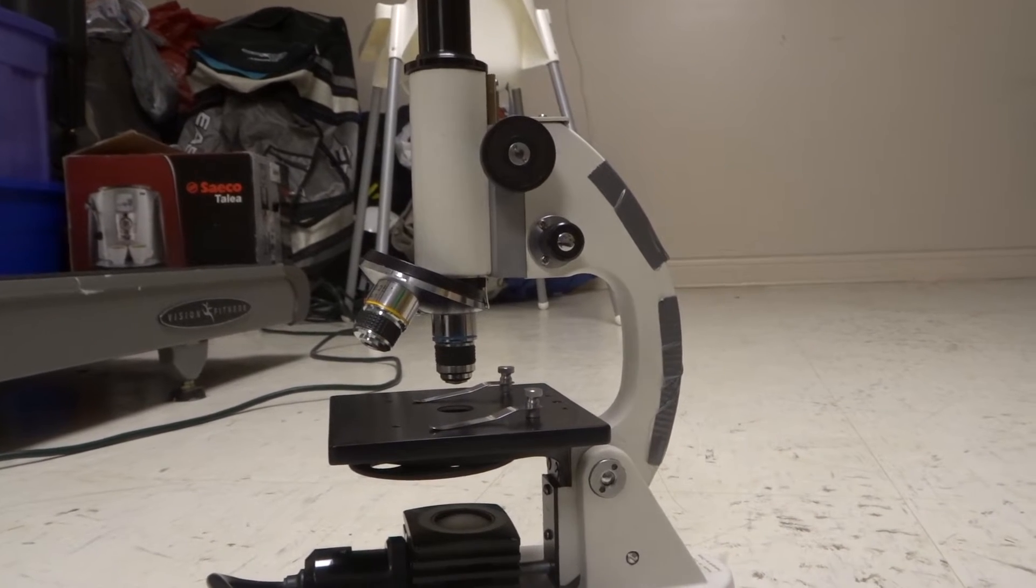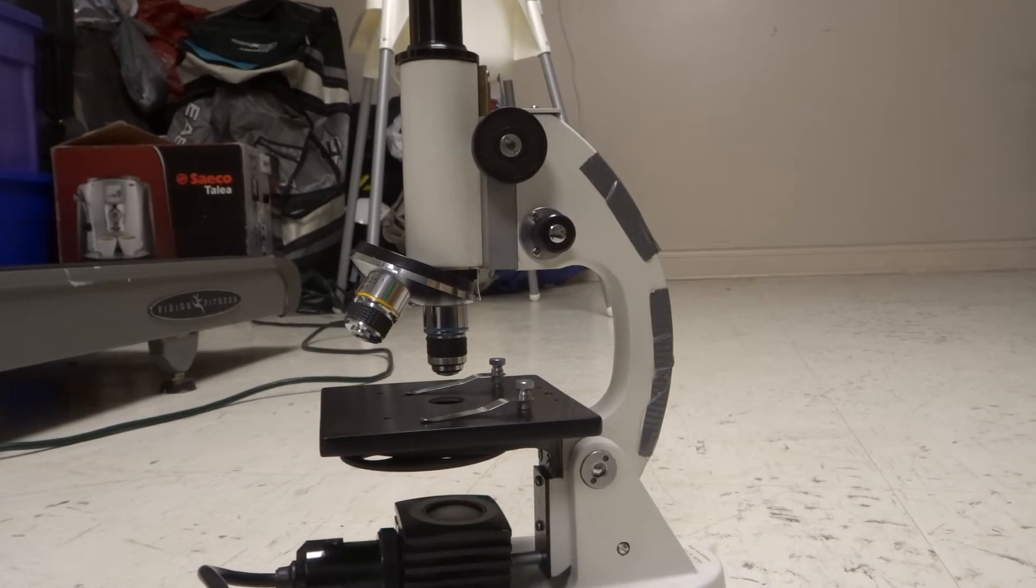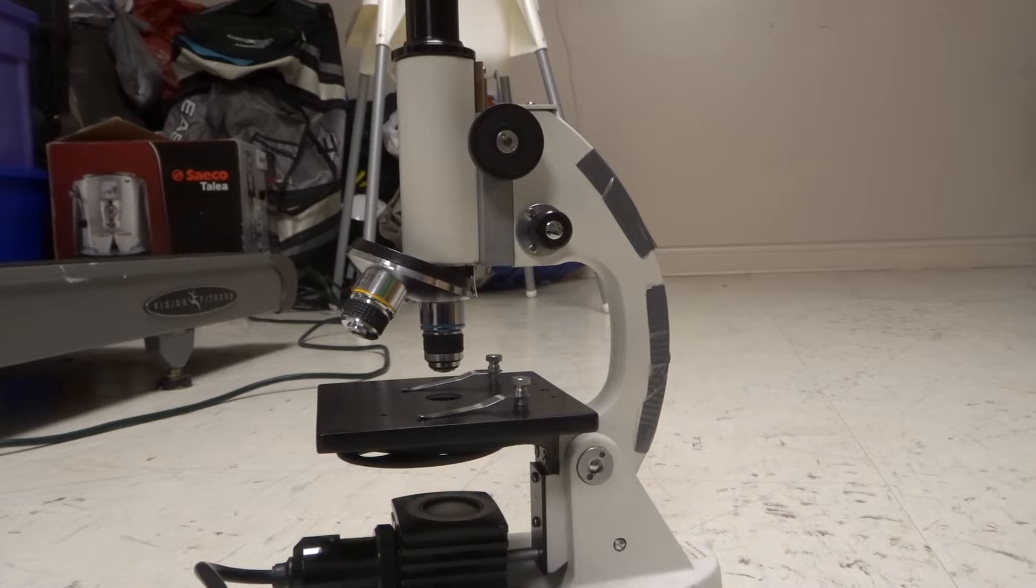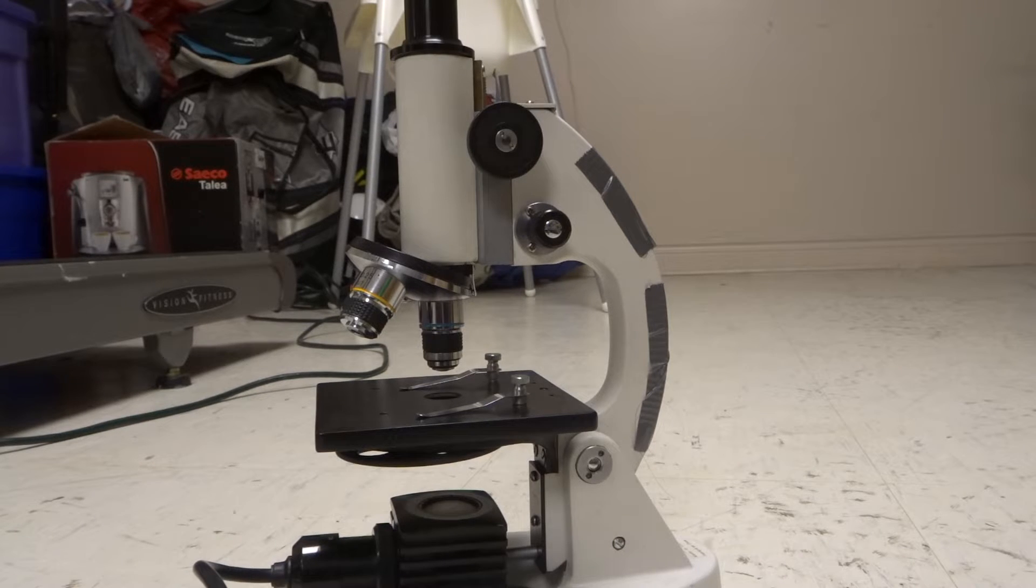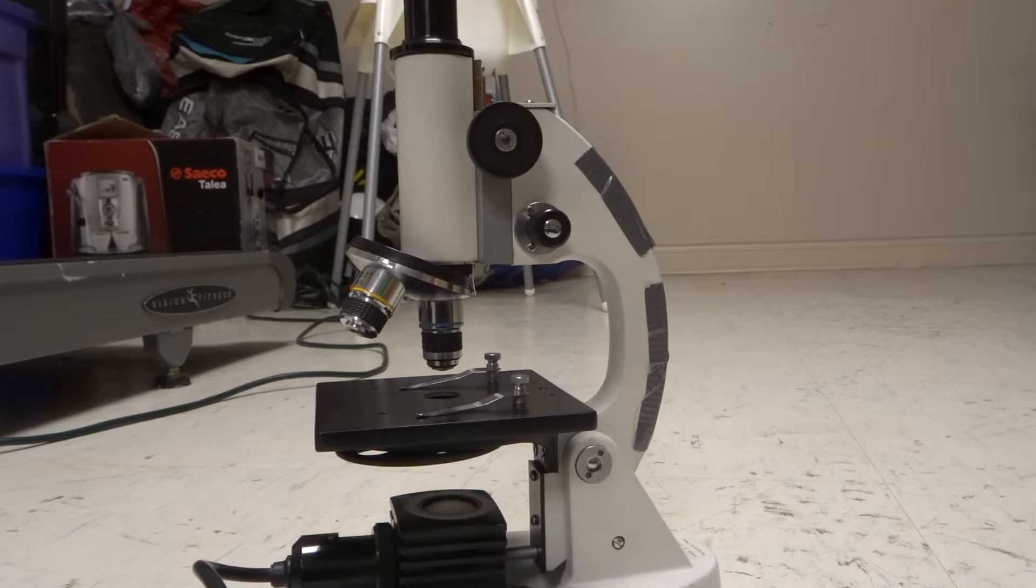Hey everybody! I'm here today to show you and tell you how to focus a microscope. These will be easy adjustment instructions and this will be a tutorial for absolute beginners. So let's get right into this video.